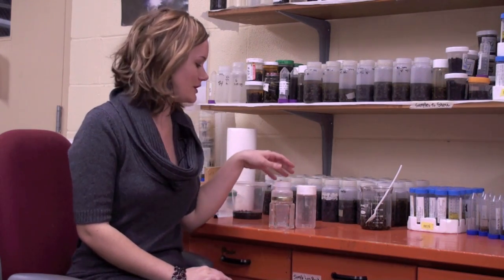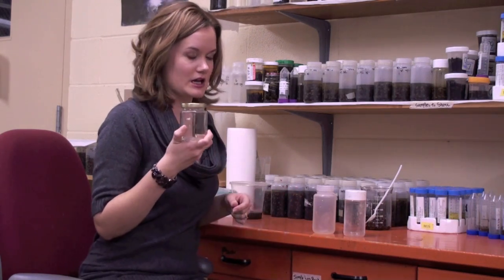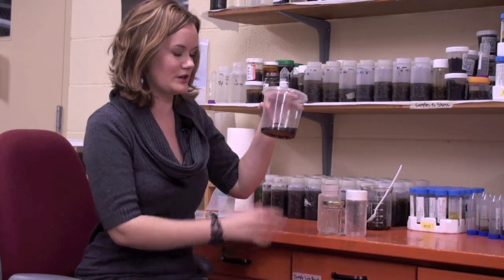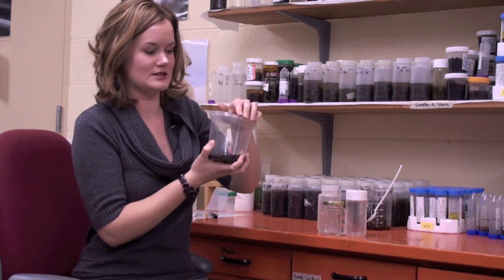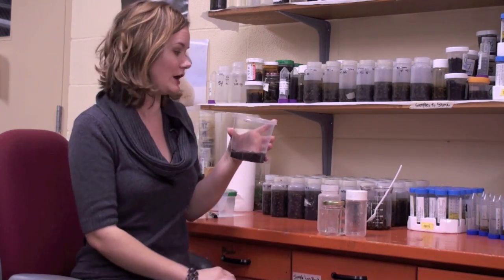Next, we're going to talk about the most efficient way to send samples to me. I have three examples here of great bottles or honey jars that you can send your bees in. This is a simple Nalgene bottle, and that's always good. This is a makeup or lotion container — it's fine too, as long as the bees can fit into it, it's easy for me to get into, and it's airtight. You can use a honey jar as well because it's airtight. A bad example is a regular kitchen food storage plastic bin, because it's easily opened and not very tight — it will easily pop open or get squished in the mail and your bees can come out.